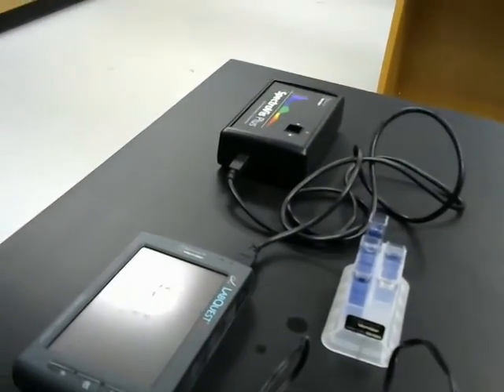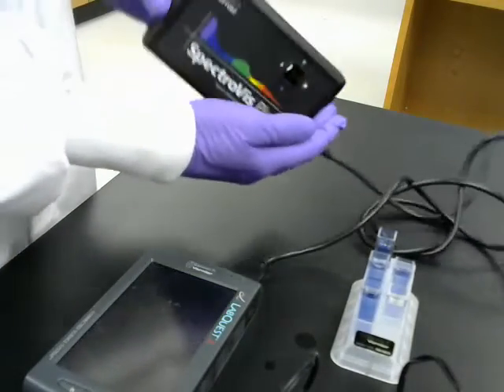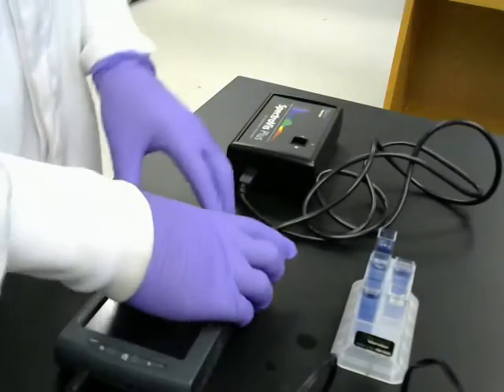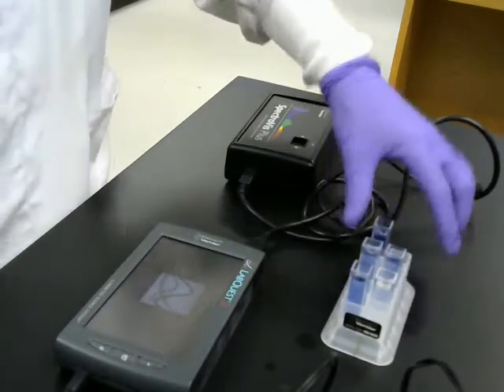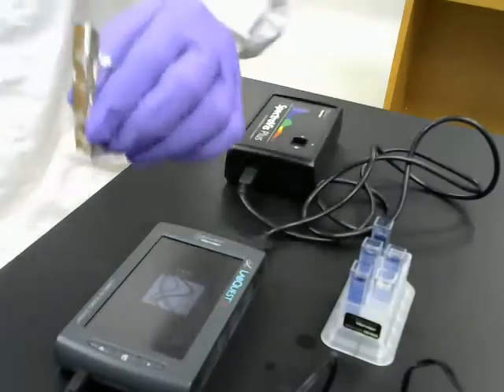Now, I'm going to get this camera set up over here. Show you what I'm going to wind up doing. So here at the end of the bench, I have my spectrophotometer. Again, here's the spectrophotometer part, and here's the computer part. I haven't yet set that up. Get that turned on right now. So here are my cuvettes, and my dark control.